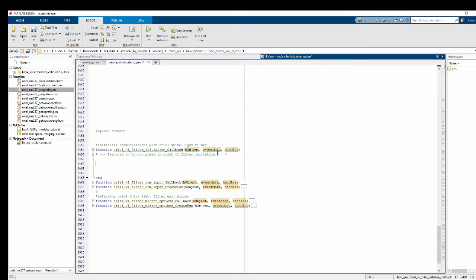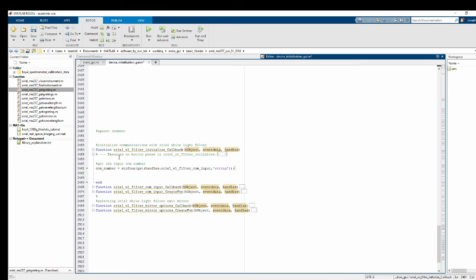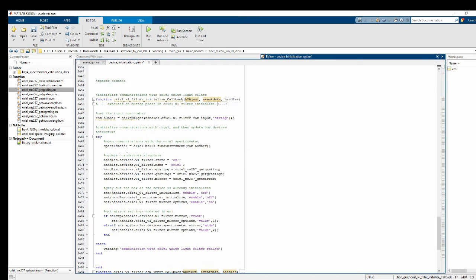Okay, the first part here, any COM port device, what you've got to do is get the input that the user gave for the COM. I've already written this, so I'm just going to copy and paste it. So this reads out that number 20 that we have written in that one box. Now, of course, if that number changes, if it's on another COM port, the user can change that number, or they can go into Device Manager and change that, but this is how we put it in here. And then what we want to do is try to open up communications. And the way I like to do this is with a try-catch statement. Probably not great coding, but that's what I do.